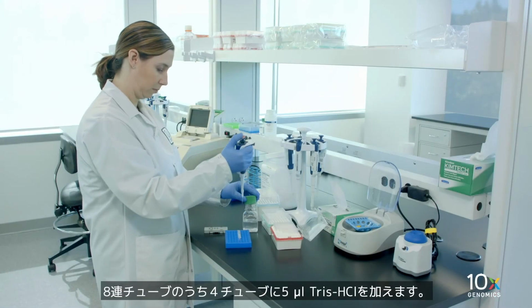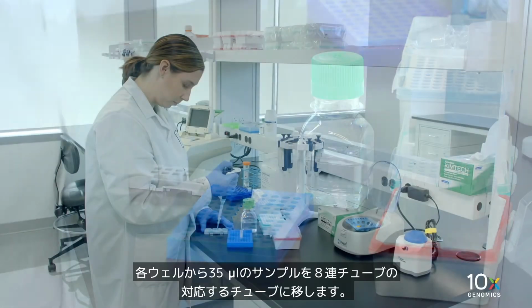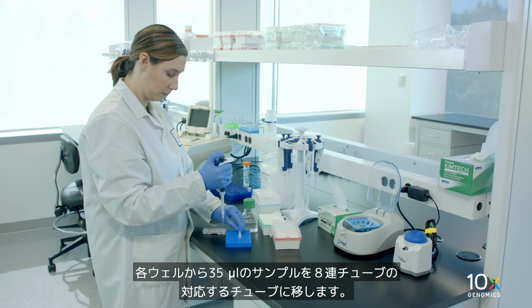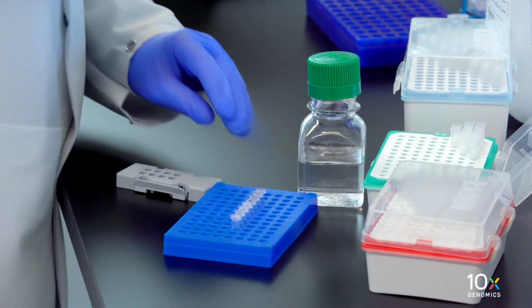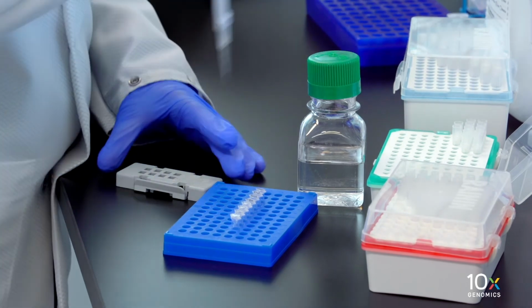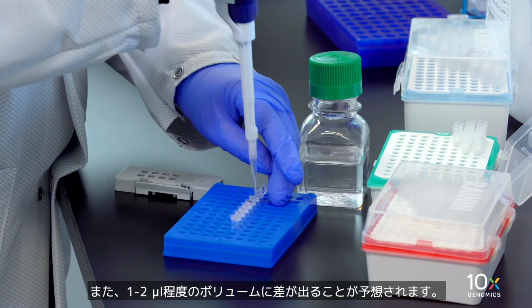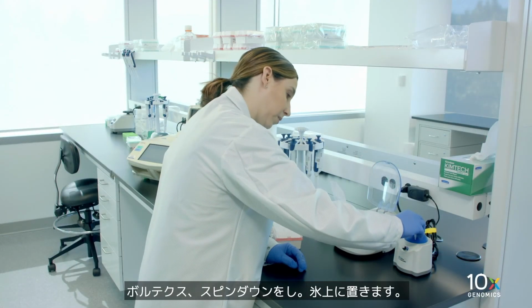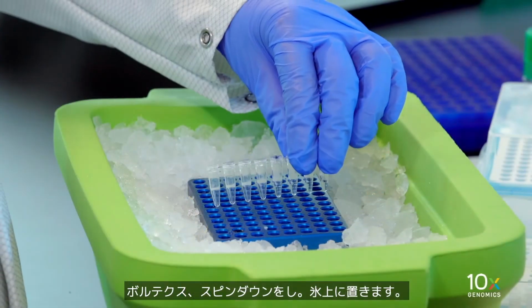Add 5 microliters tris to 4 tubes in an 8-tube strip. Transfer 35 microliters sample from each well to a corresponding tube in the 8-tube strip. Do not discard sample. Approximately 1 to 2 microliter volume variation is expected. Vortex, centrifuge briefly, and place on ice.